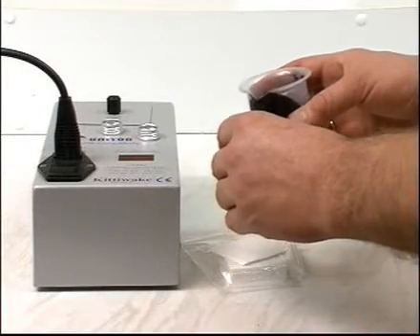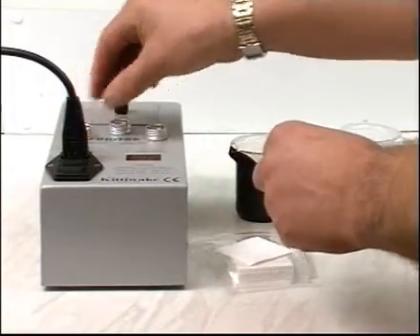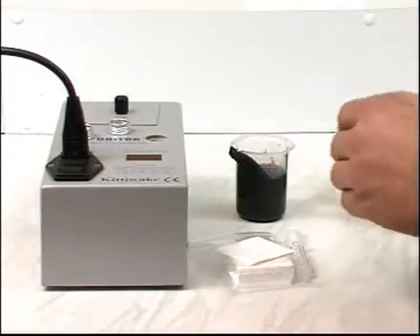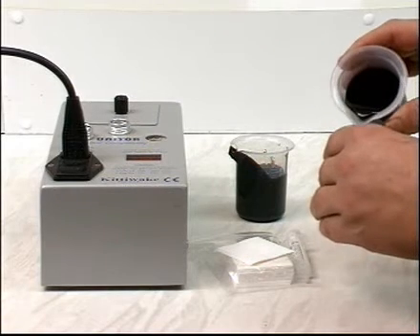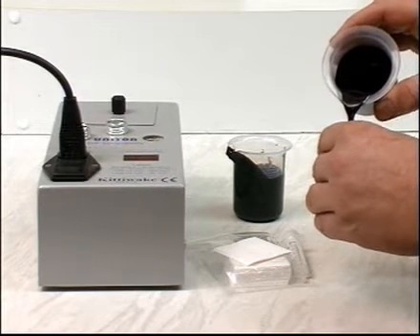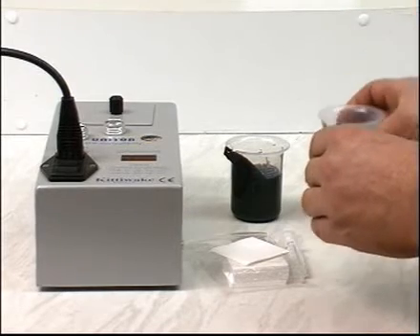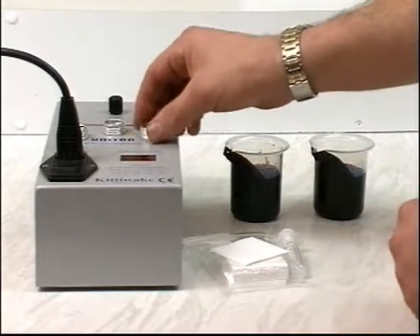Any rating other than one means that the oil is likely to deposit sludge to some extent. To find if two fuel oils are compatible, first repeat the sample preparation procedure used in the stability test. Take two fuel samples and place them in the preheat holes of the fully heated unit. Press reset and leave for five minutes.